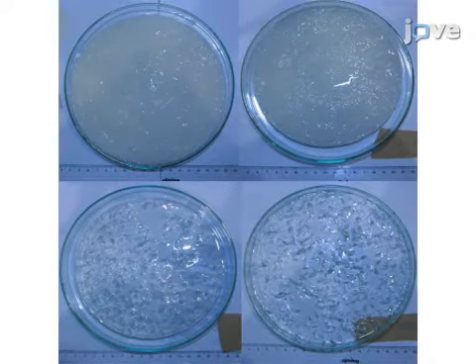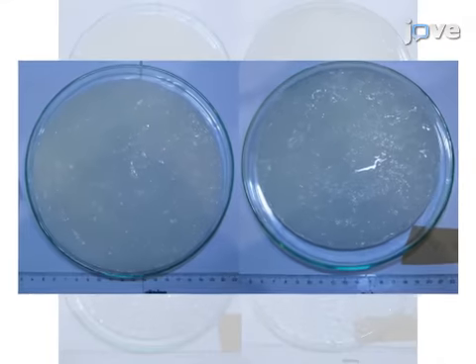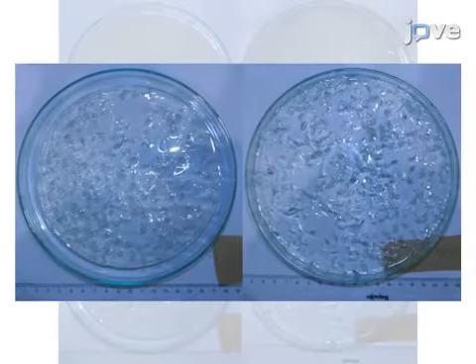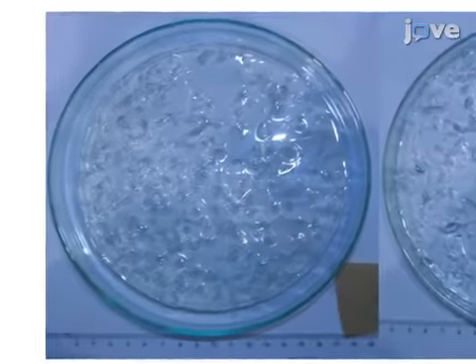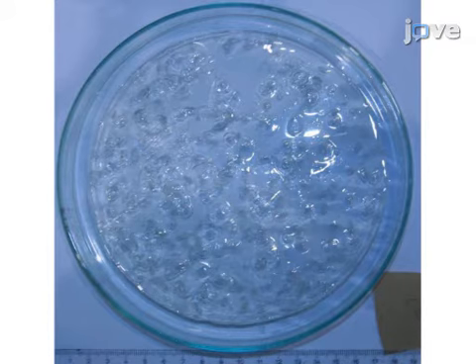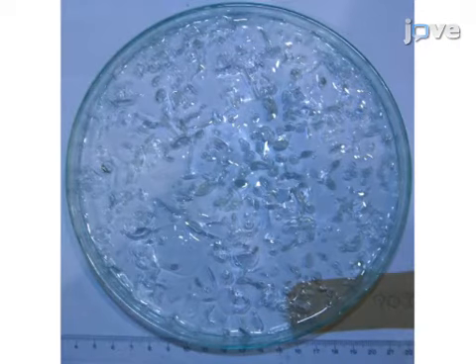Biopolymer concentration plays an important role in the transparency of the hydrogels. 1 and 2% samples were not transparent, but 0.5 and 1/4% samples were. These percentages were given by weight. Bubbles were created in the hydrogels during the depressurization when the dissolved carbon dioxide left the gel water system due to a decreased carbon dioxide solubility. A deep reduction in the biopolymer concentration to 0.25% yielded stable but fragile hydrogels.